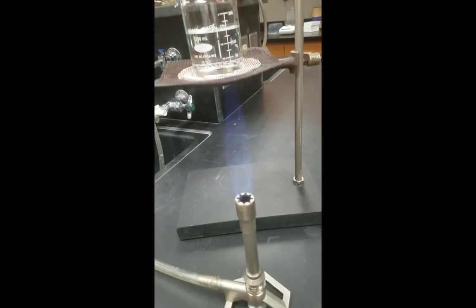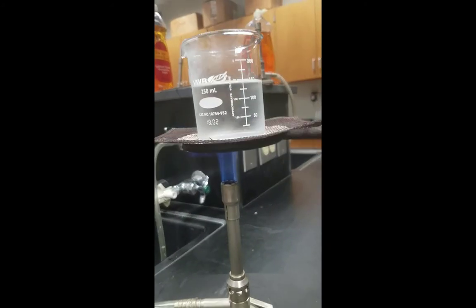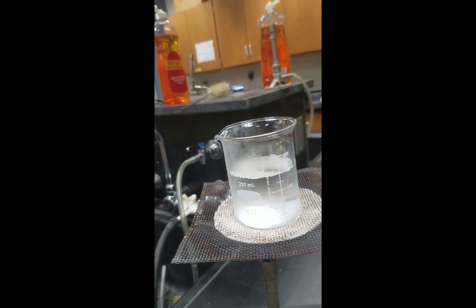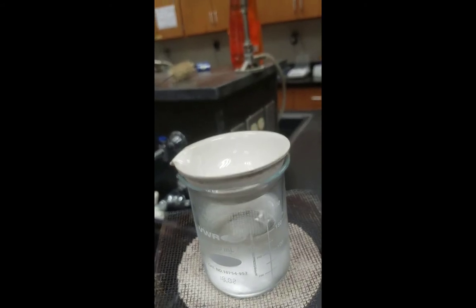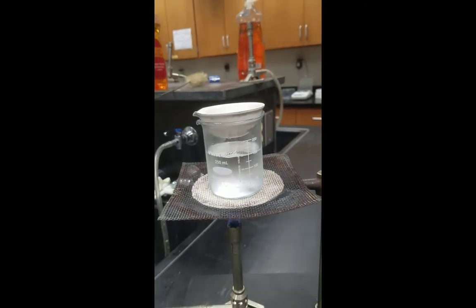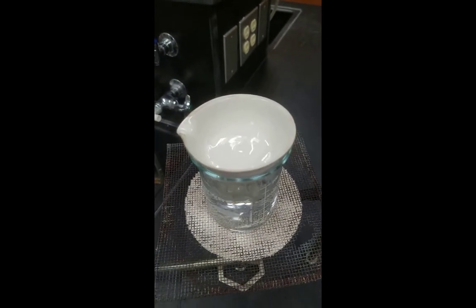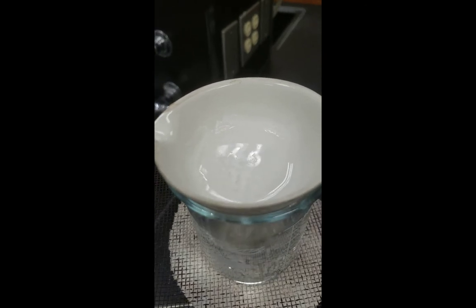Now I set up my steam bath by using a Bunsen burner placed underneath a beaker which is about half filled with water. You notice that the water immediately begins to steam up as I am heating the beaker with the hottest part of the Bunsen burner. I then carefully place the evaporating dish right over the top of the beaker. The water in our steam bath is now boiling, producing steam which is heating the solution in the evaporating dish. As time passes, you note that salt is starting to form on the sides of the liquid.